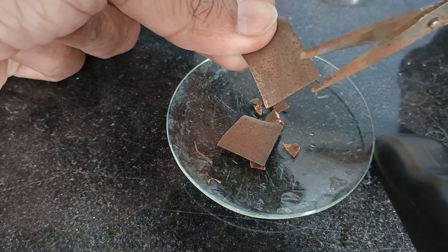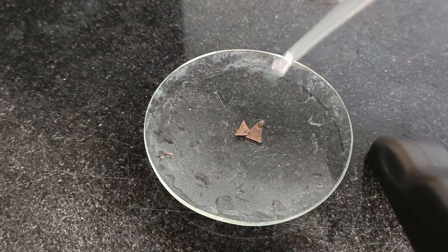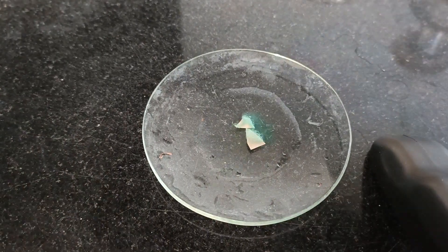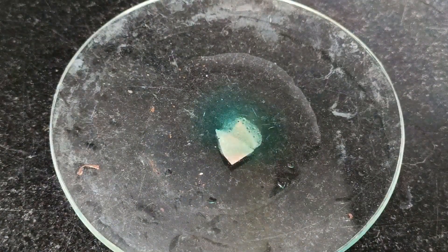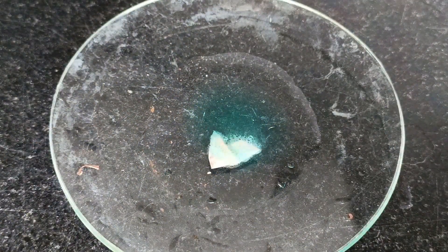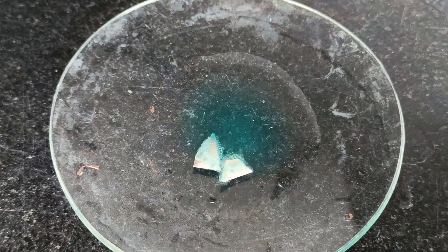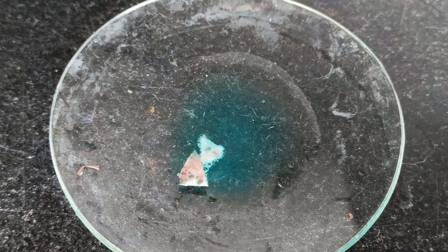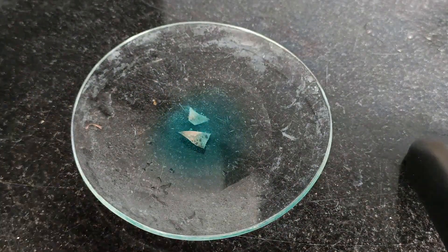You can very well see that the copper pieces can be easily cut with the help of scissors. Adding some amount of concentrated nitric acid on a few copper pieces, the reaction immediately starts. You can see that the concentrated nitric acid starts to turn blue — that is due to the formation of cupric nitrate. Slight nitrogen dioxide gas which is reddish brown in color is also visible.